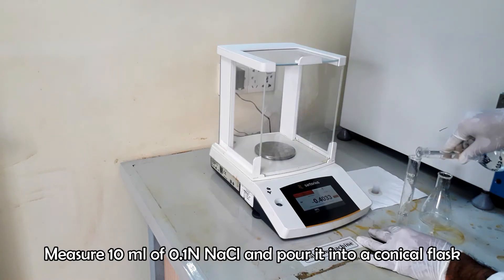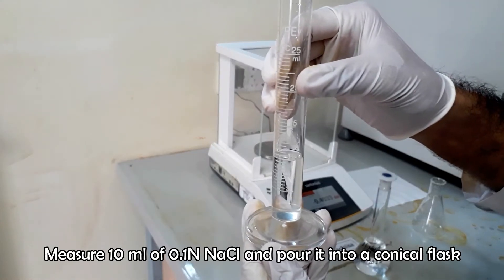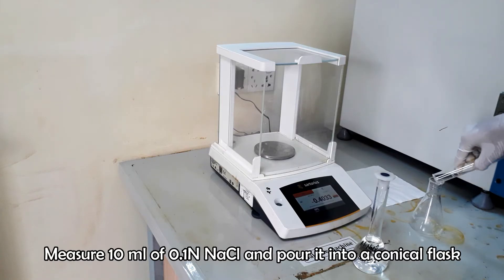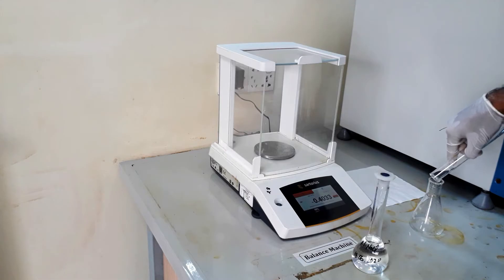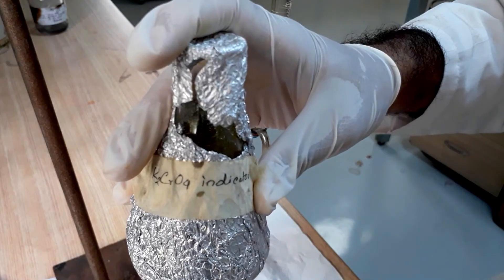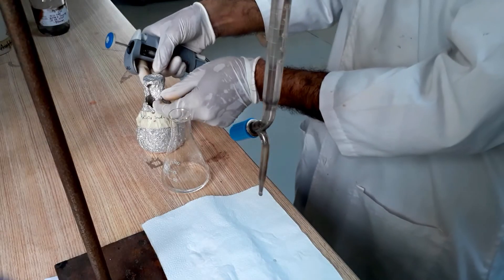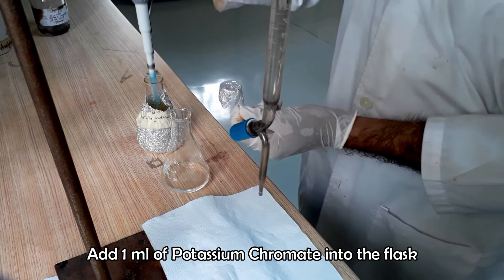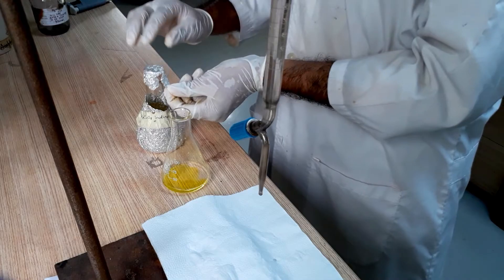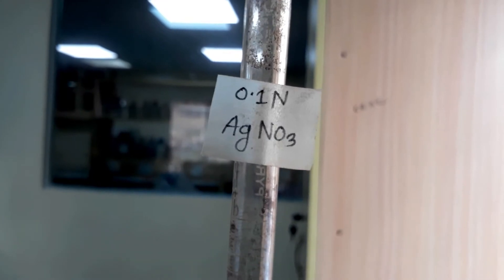Take 10 milliliters of freshly prepared 0.1 normal sodium chloride in a conical flask. Add 1 milliliter potassium chromate indicator solution and shake to mix well. Take 0.1 normal silver nitrate solution in the burette, which is to be standardized.